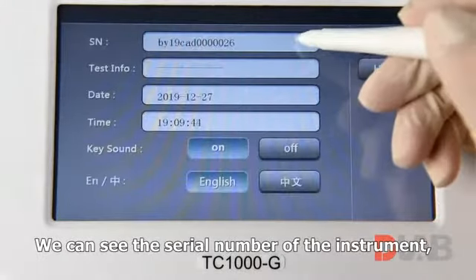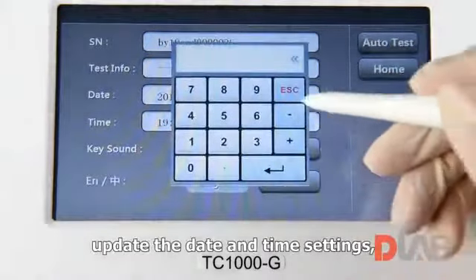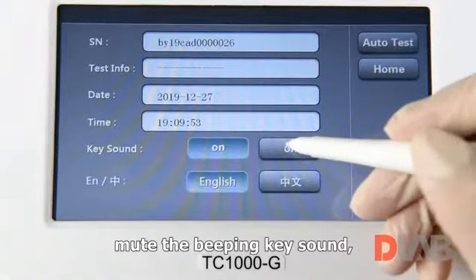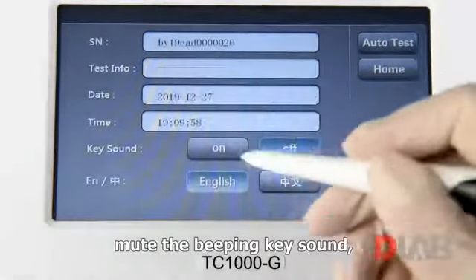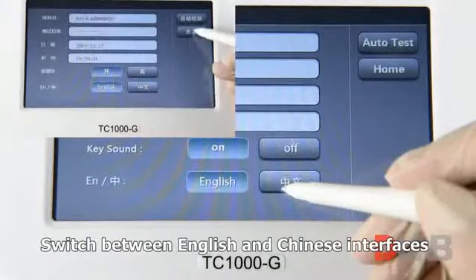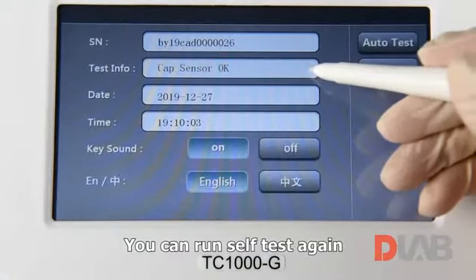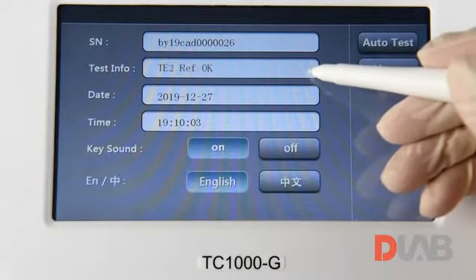We can see the serial number of the instrument, update the date and time settings, mute the beeping key sound, or bring it back again. Switch between English and Chinese interfaces. You can run self-test again, exactly the same as the power on.